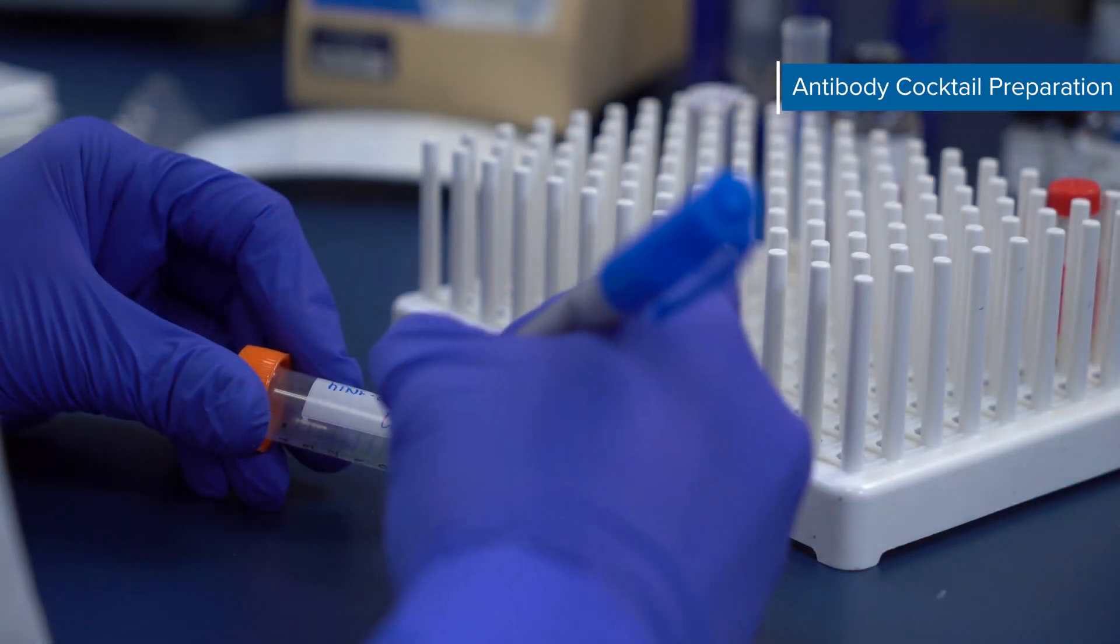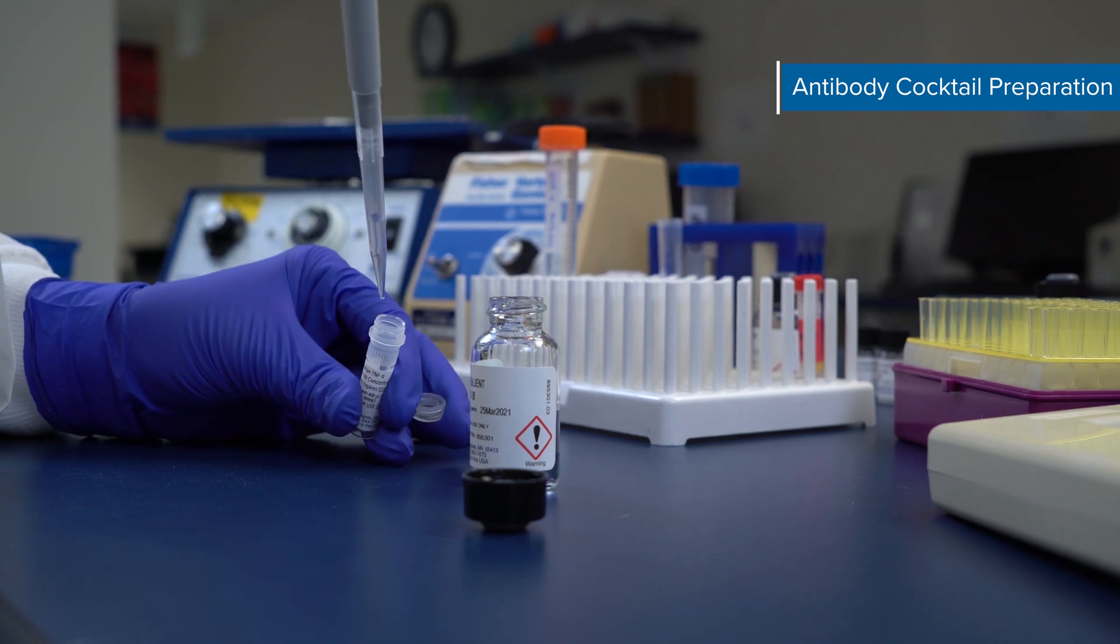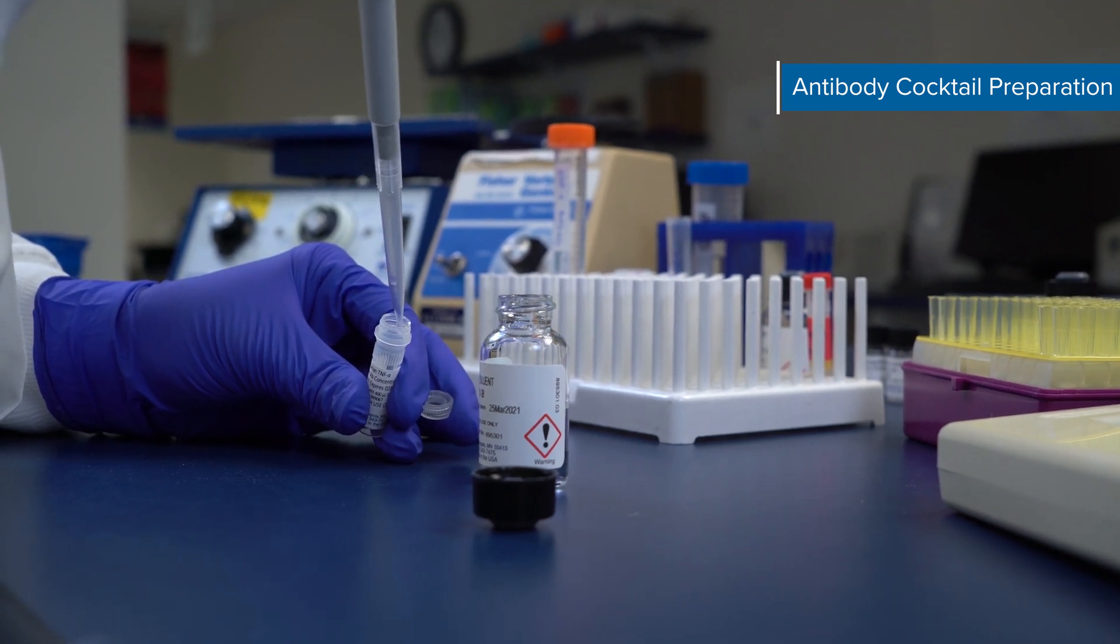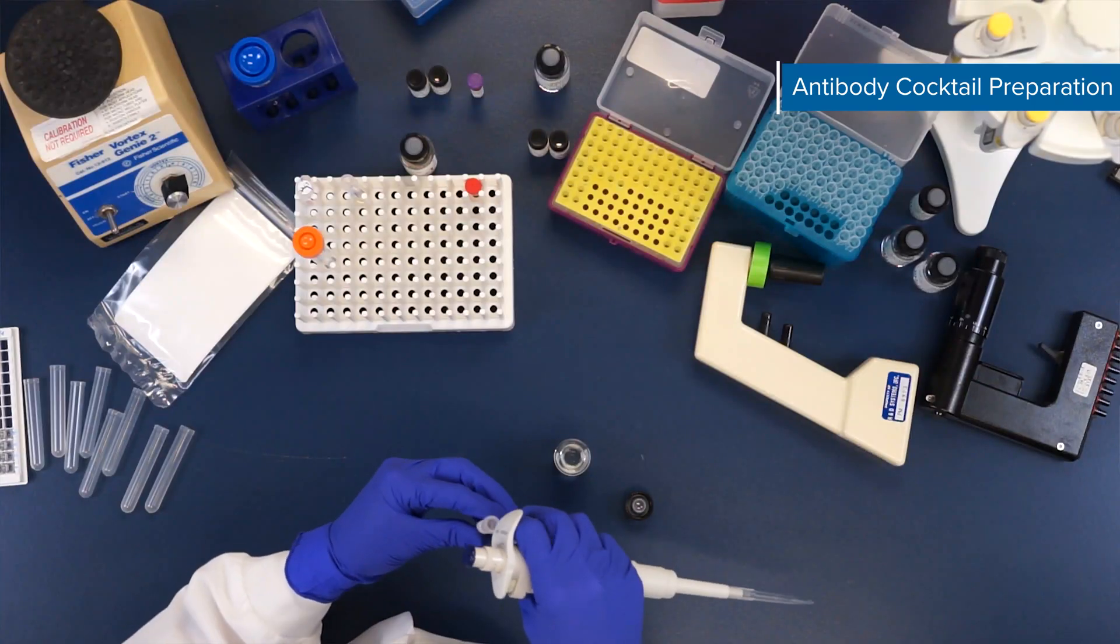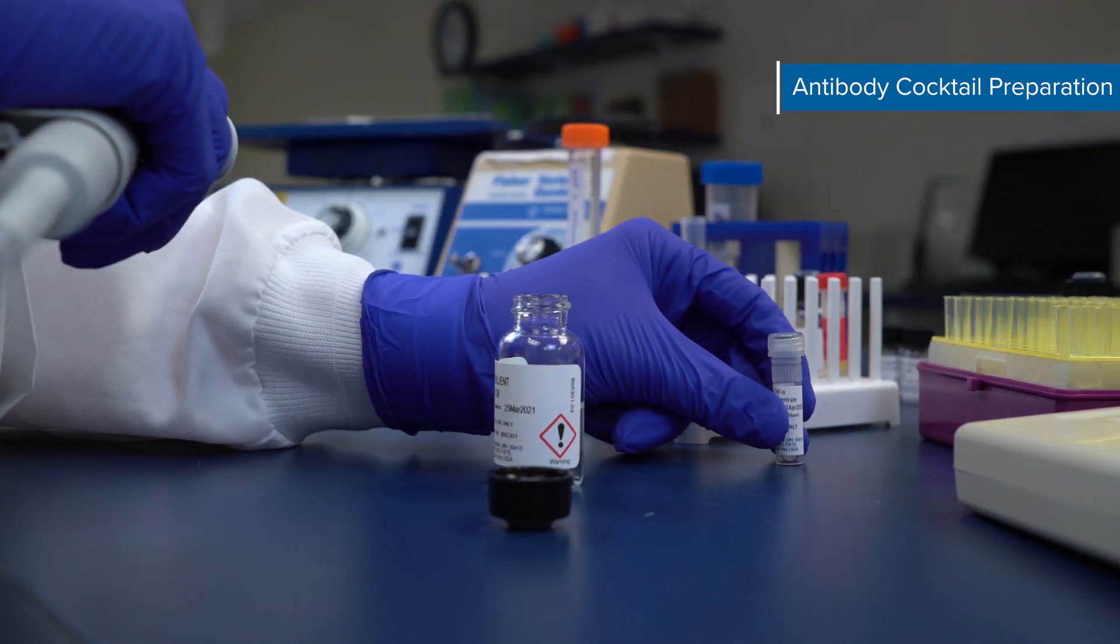Next, prepare your antibody cocktail. Reconstitute the human TNF-alpha capture antibody concentrate with 400 µL of the specified diluent. Gently mix to ensure complete reconstitution. Avoid vigorous mixing and let rest on the benchtop for a minimum of 5 minutes.